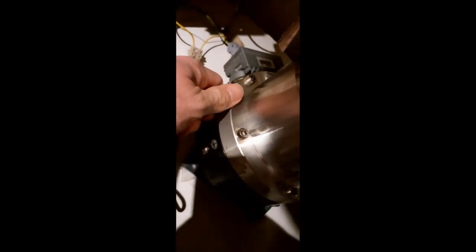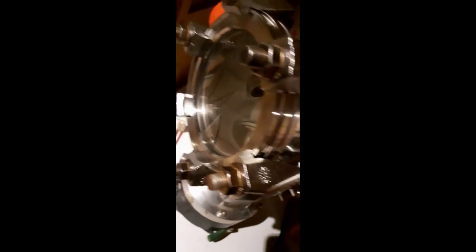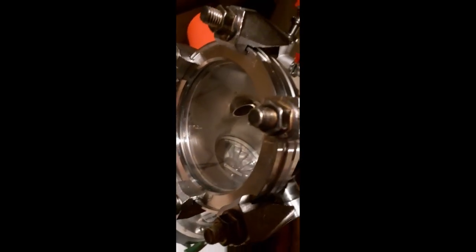This is a bleed valve. You can open this and then it just vents the turbo somewhere in the molecular drag stage, like halfway up the turbo. And that's supposed to be a gentle way of letting in air while you're powering down. The manual says you can do that without incident if it's below 50% rotational speed. I've done it once. I'm not very happy about it, so I'm just going to let it speed down on its own. It doesn't take long. It speeds up in less than 2 minutes also.